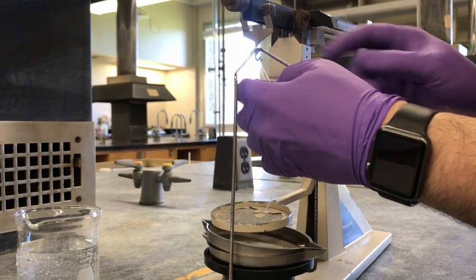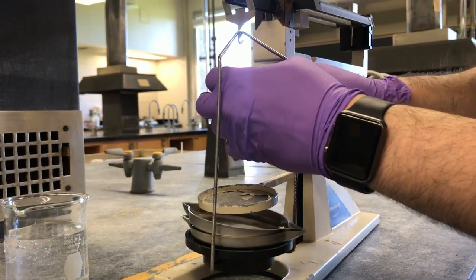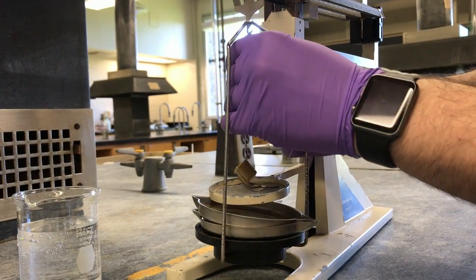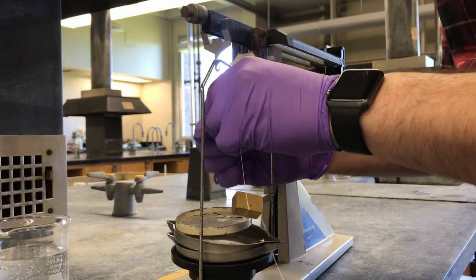We're going to record this whole process. This also, future TAs don't have to feel bad about how difficult this is. It seems so simple. The thing is, I've done this so many times, but it's still difficult. No, it's still low. I'm going to pause and we're going to get this.